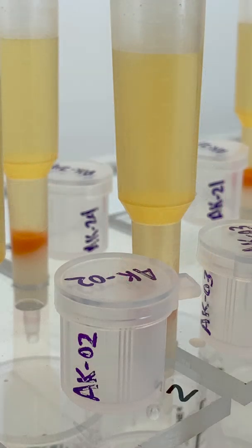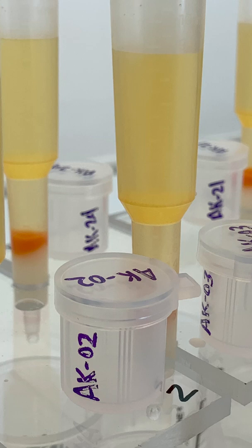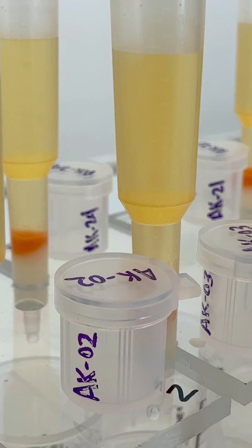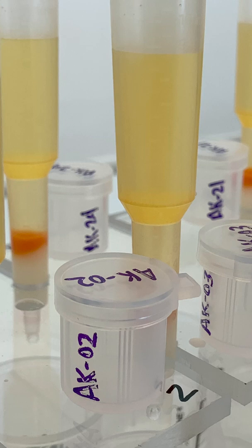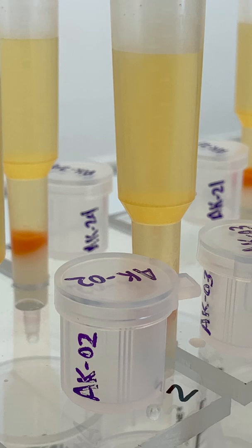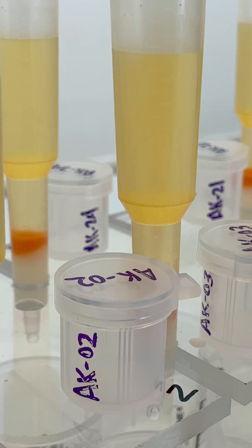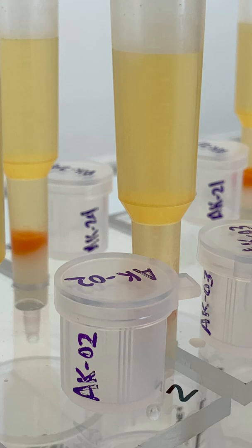Once our samples have been dissolved and they're a pure liquid, we run them through columns for purification. At the base of these columns is a resin — essentially just little tiny beads that have different affinities for all the different elements on the periodic table. As a solution drips through that resin, all the elements that were in that rock connect and bond with it. By using a different series of acids and concentration solutions, I can actually selectively remove different elements at a time. So I can take a rock that has little bits of almost every element on the periodic table, run it through these columns, and pull out a solution that has just a single element in it — completely purified.